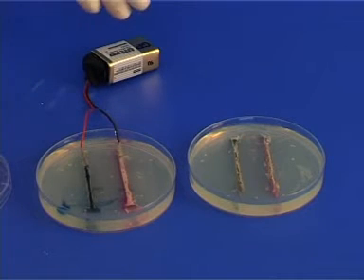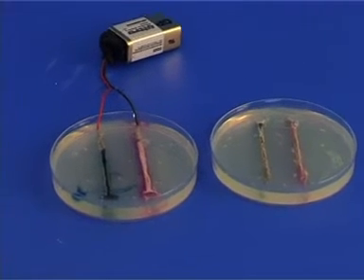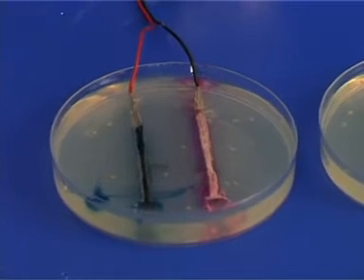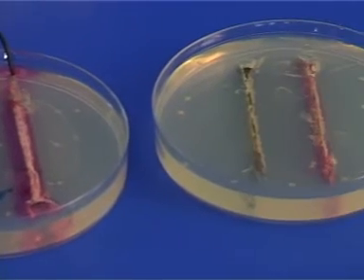The forced non-spontaneous reaction is quick, whereas it might take 20 minutes until you can easily observe the colors in the spontaneous reaction.